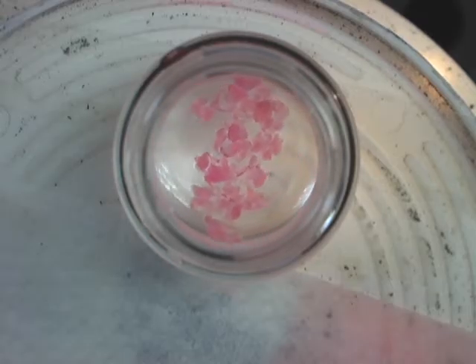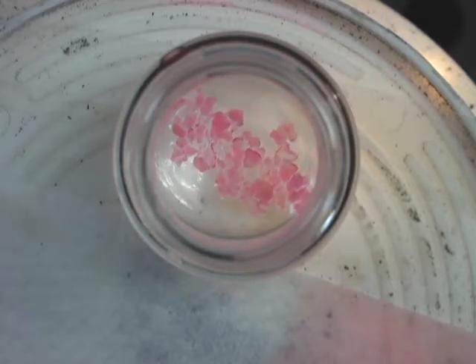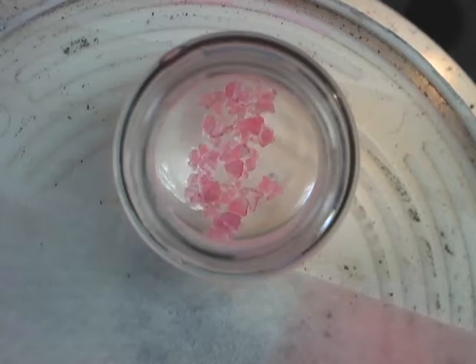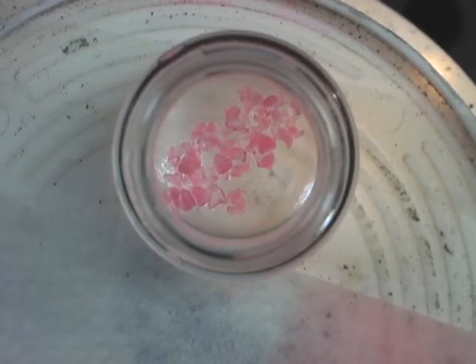Again, you can see clear water, and that confirms our nanomaterial has absorbed all of the oil.